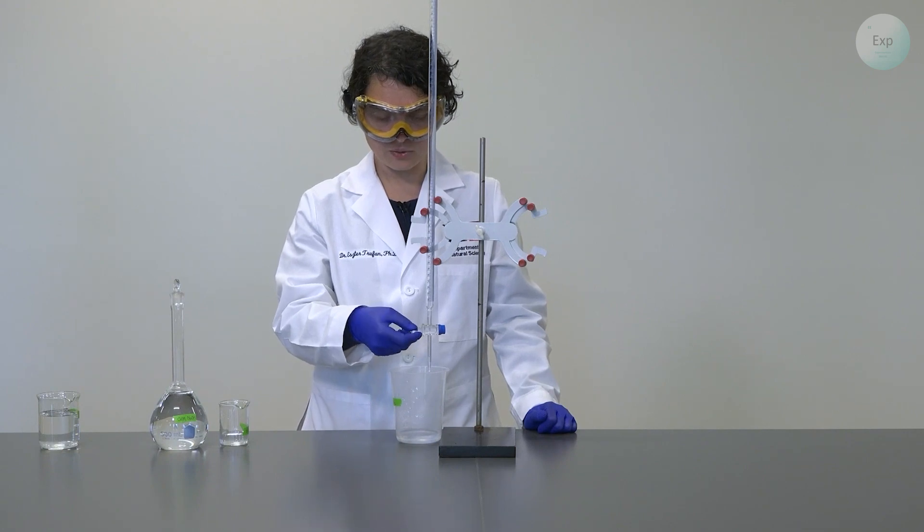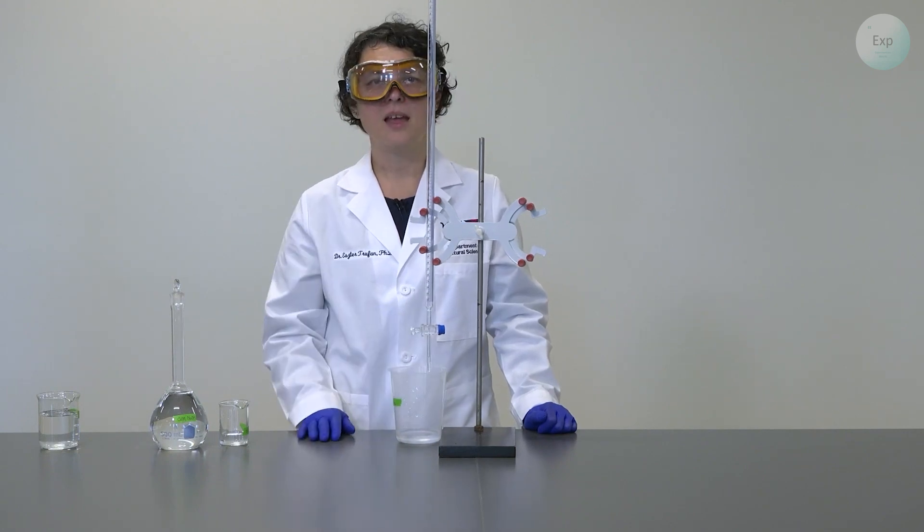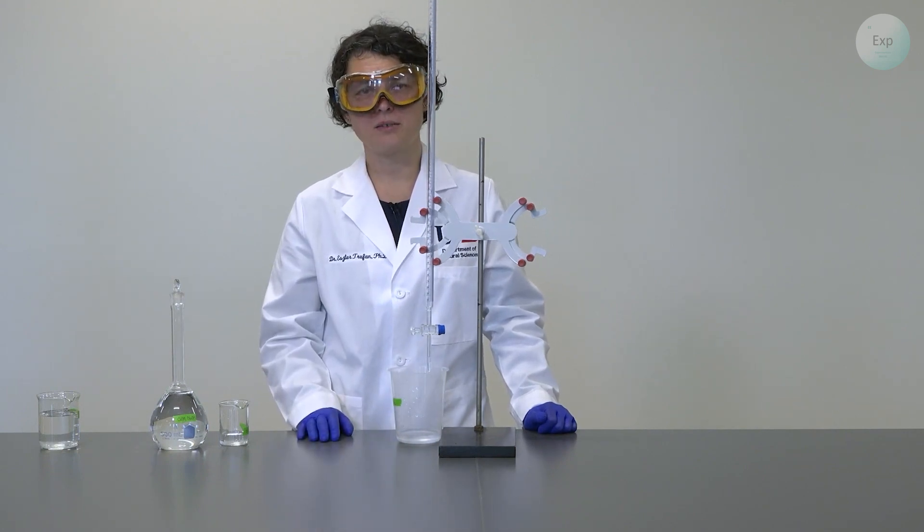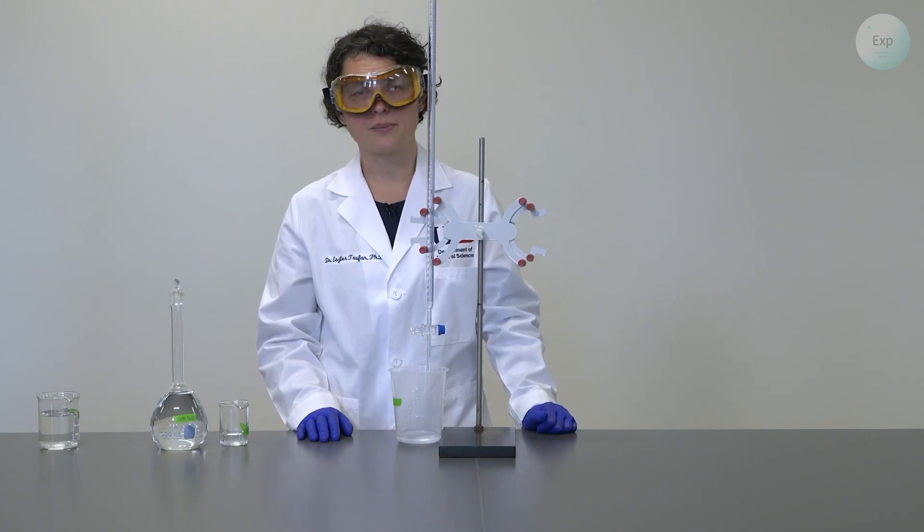Once you're done, you close the stopcock and you repeat the same process of rinsing with your charging liquid two more times.